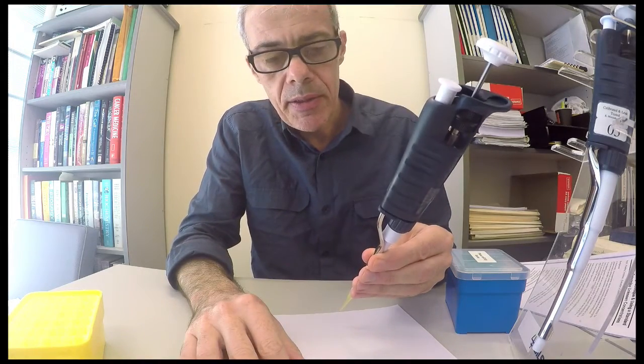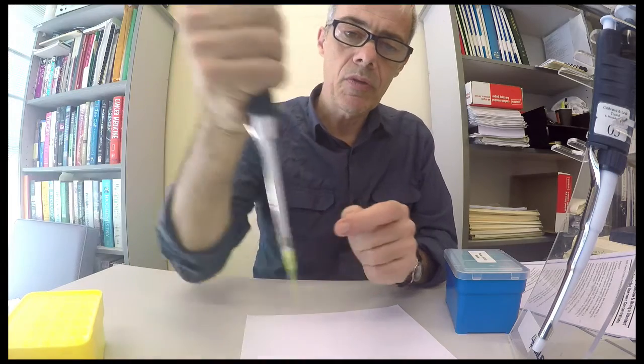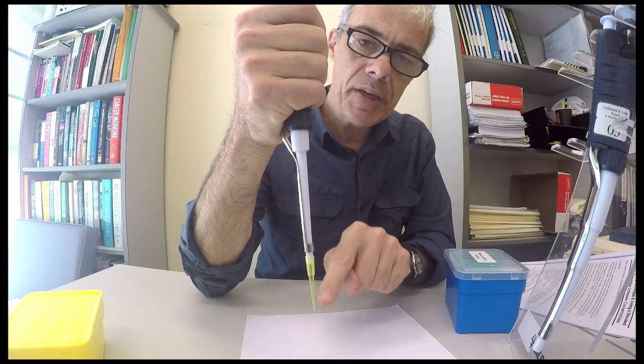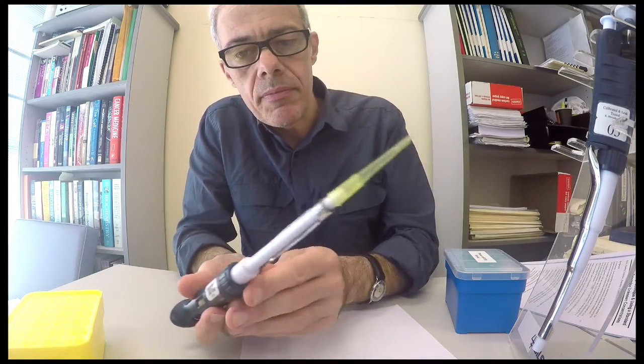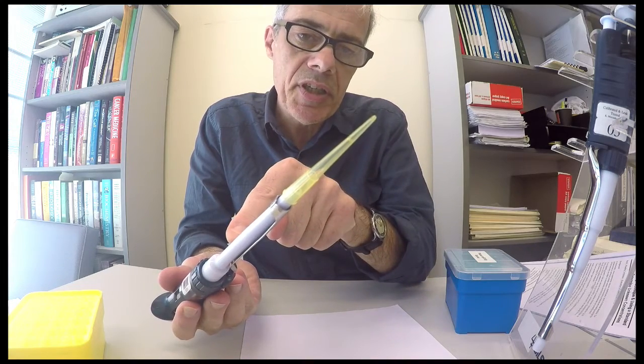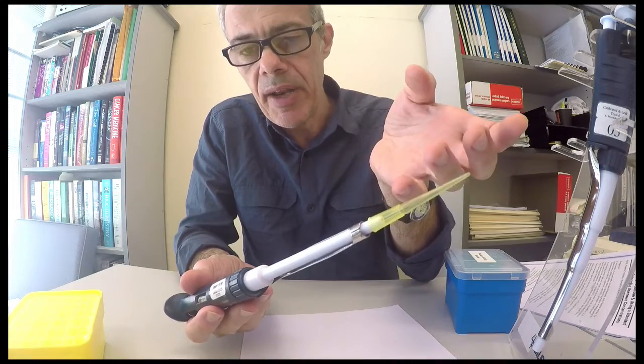When you're working with these pipettes, just imagine you've just drawn up a solution, you have a wet solution in here. If you hold it at an angle like that, the solution is going to run down the barrel into the machine and that's going to damage it, and you have to clean out the machine and it's a lot of time and effort.